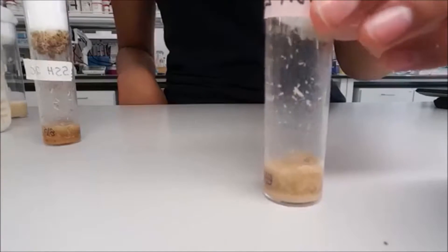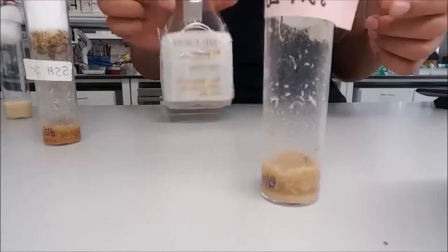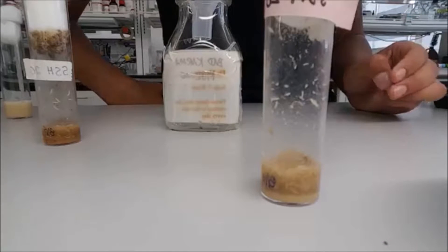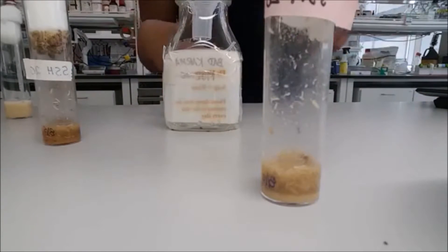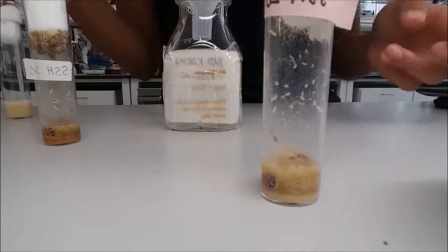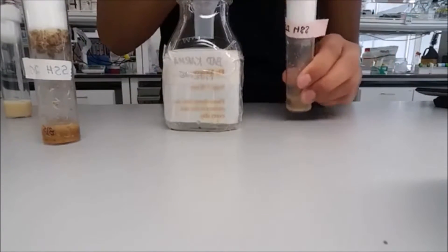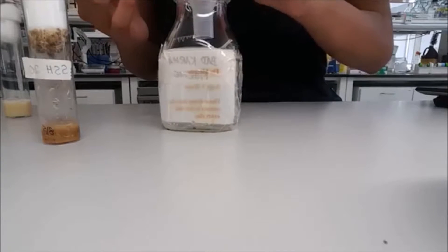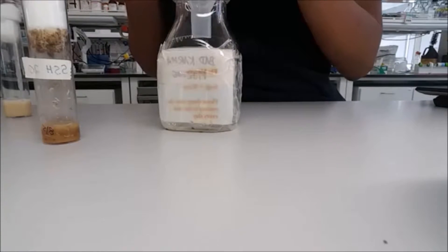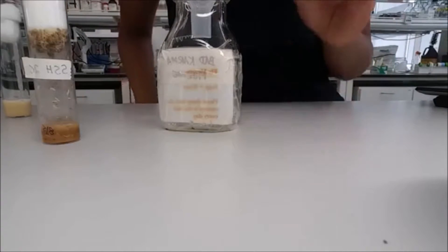This one has both larvae and adults. What we're going to do is dump out the adults into the fly morgue, because if the adults stay with the larvae the vial is going to overpopulate — and as you can see, overpopulation is really bad. We're just going to tap so the flies go to the bottom, and that's how you dump flies. That one's done.